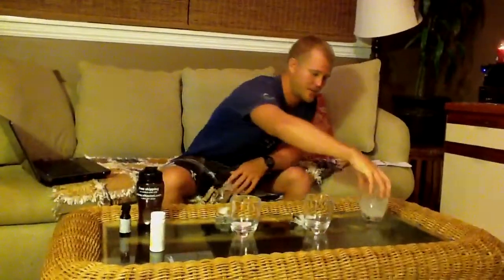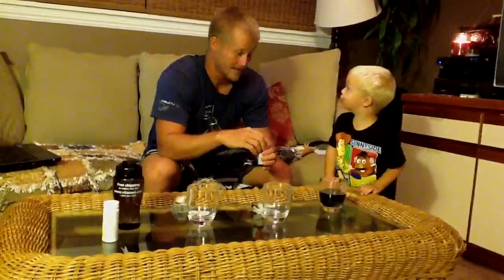would first show the students what happens when we mix cornstarch with the indicator iodine. Or, cornstarch is the indicator. So what happens when iodine mixes with cornstarch, Zeke? Naturally, the color of iodine is yellow. When I pour yellow into this, what color does it turn? Purple. It is purple. Very good.